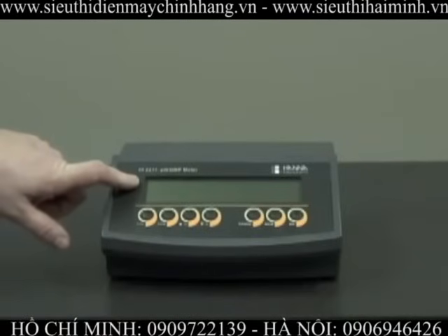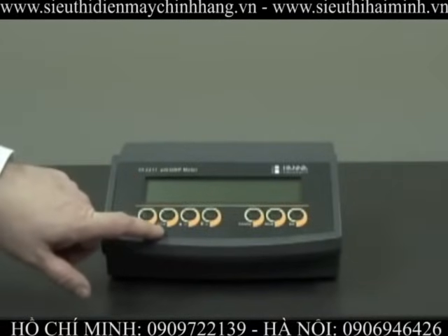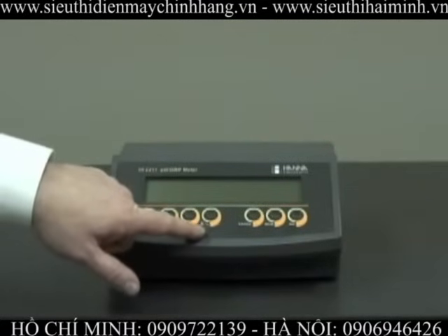We have a large LCD display. We have the calibration button and the confirm button. When we're in manual temperature compensation mode, we have the Celsius buttons up and down.